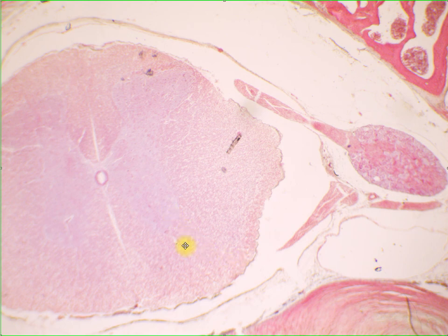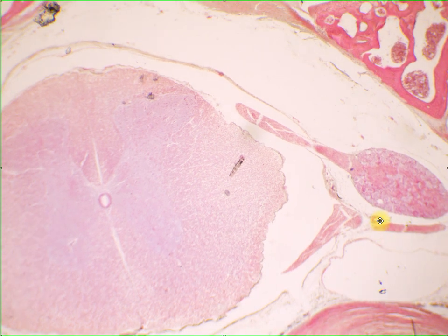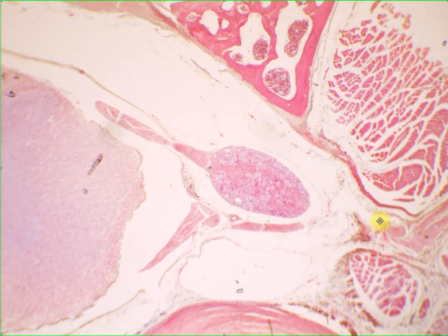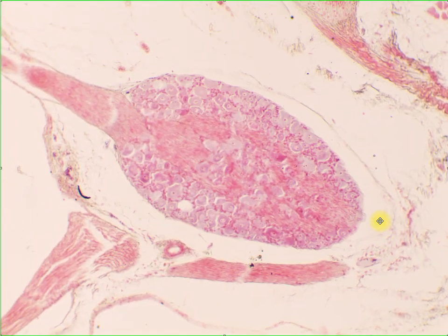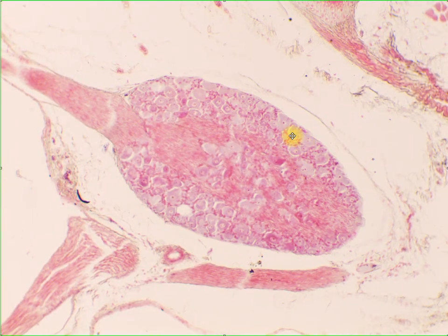And then here, it's not included in this section. Supposedly, you will have your motor neurons. Okay? Here, only the axon part of your motor neurons are included. Okay? So let's go into the high magnification of your ganglion, where we can see the cell bodies of your pseudounipolar or unipolar neurons based on structure and sensory based on function.